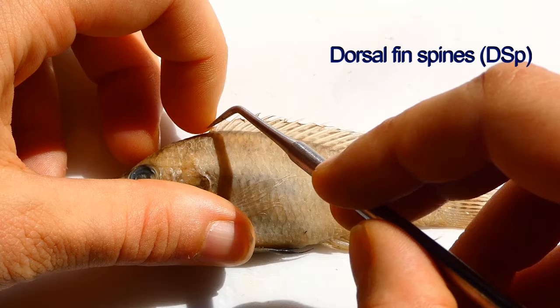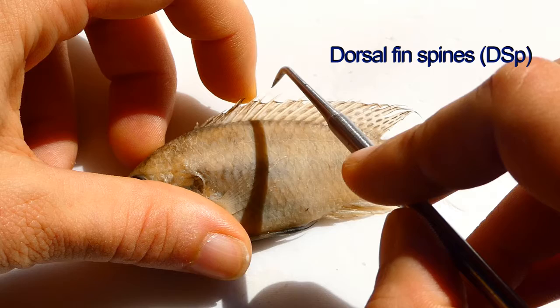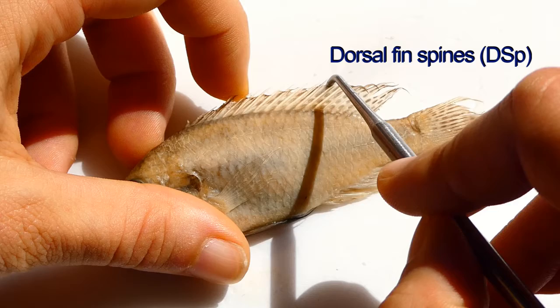We'll start on the dorsal fin, counting the spines. Just holding the first spine with your finger and then using the stick to count each one. So we've got 1, 2, 3, 4, 5, 6, 7, 8, 9, 10, 11, 12, 13, 14 — and that's it.